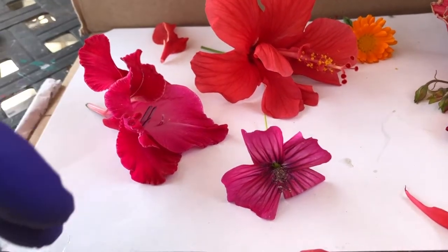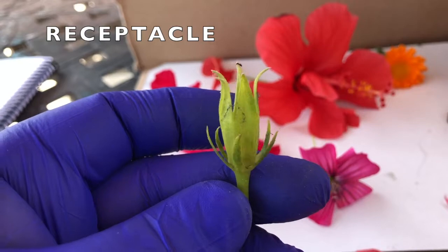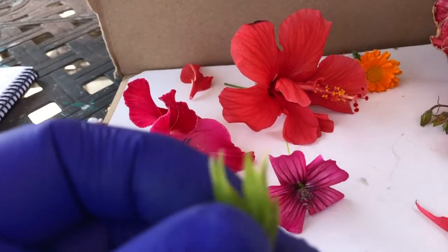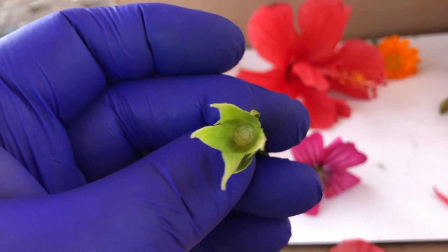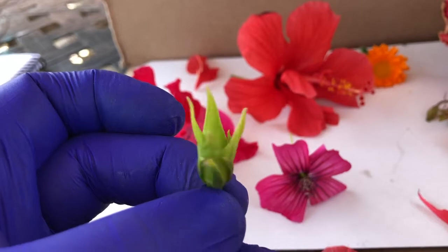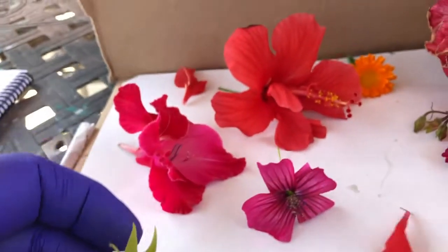And so we'll start it off with the receptacle, and the receptacle looks like this when it's empty. Here's another example of the one from a flower like the one I just showed you. Here's the inside. So it's just like a vase, if you will. And a receptacle really means container. So it's containing everything that the flower has.